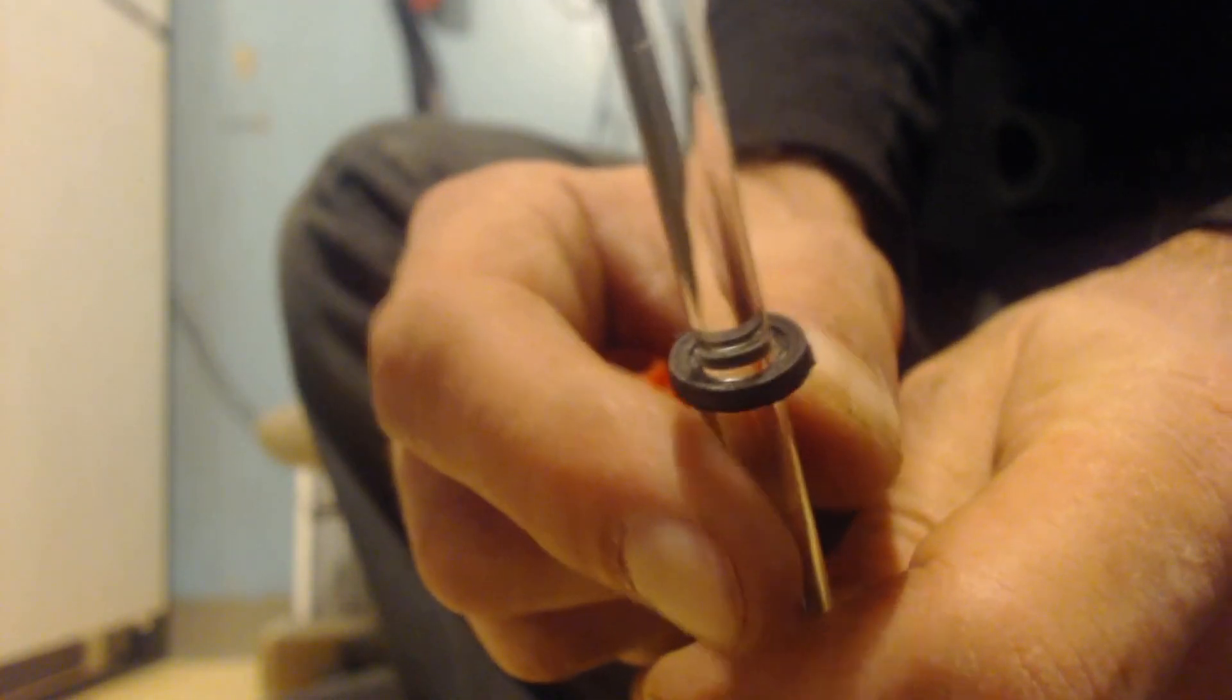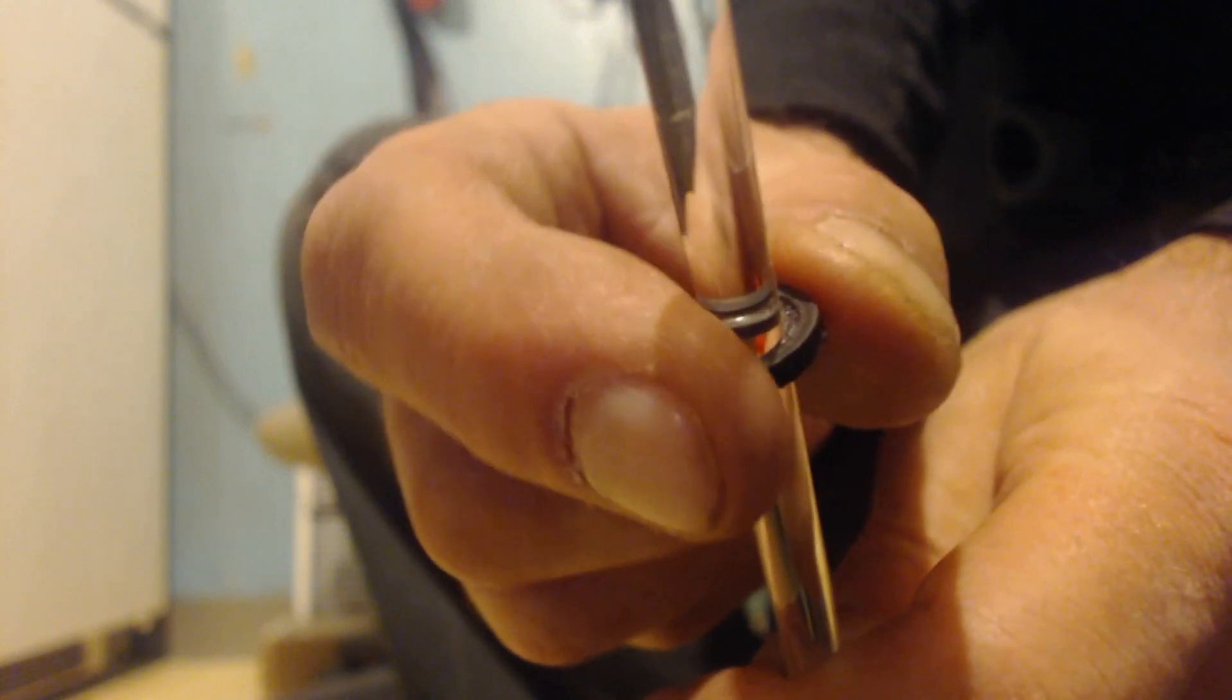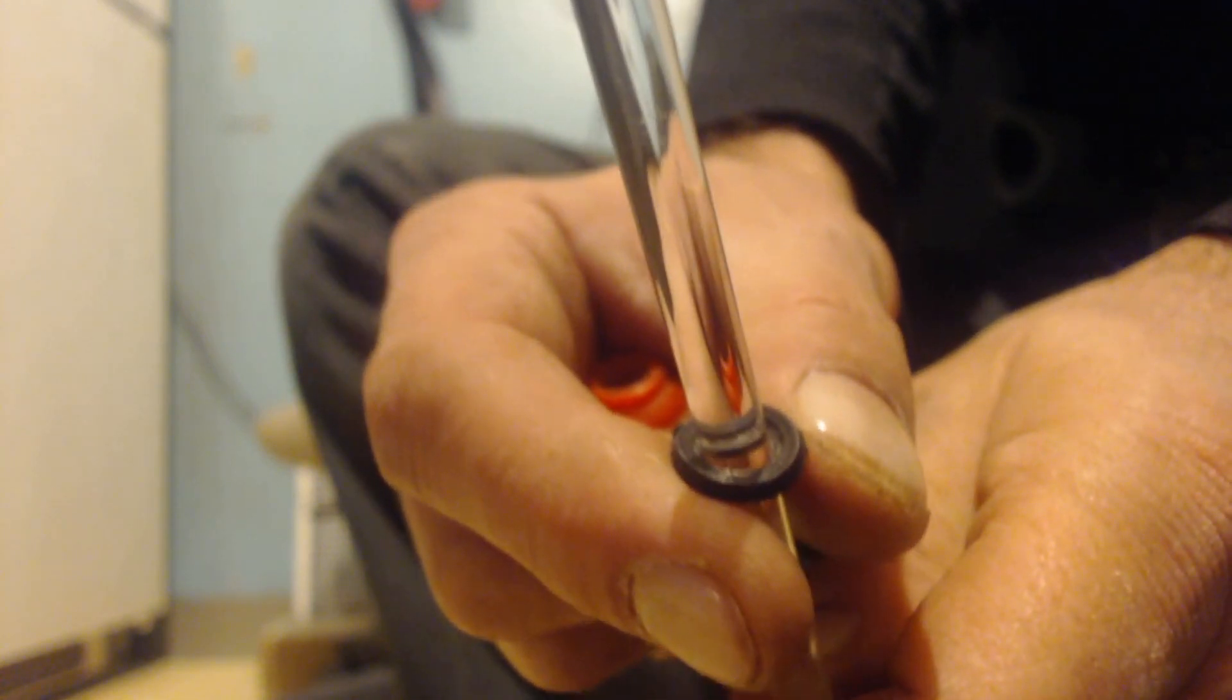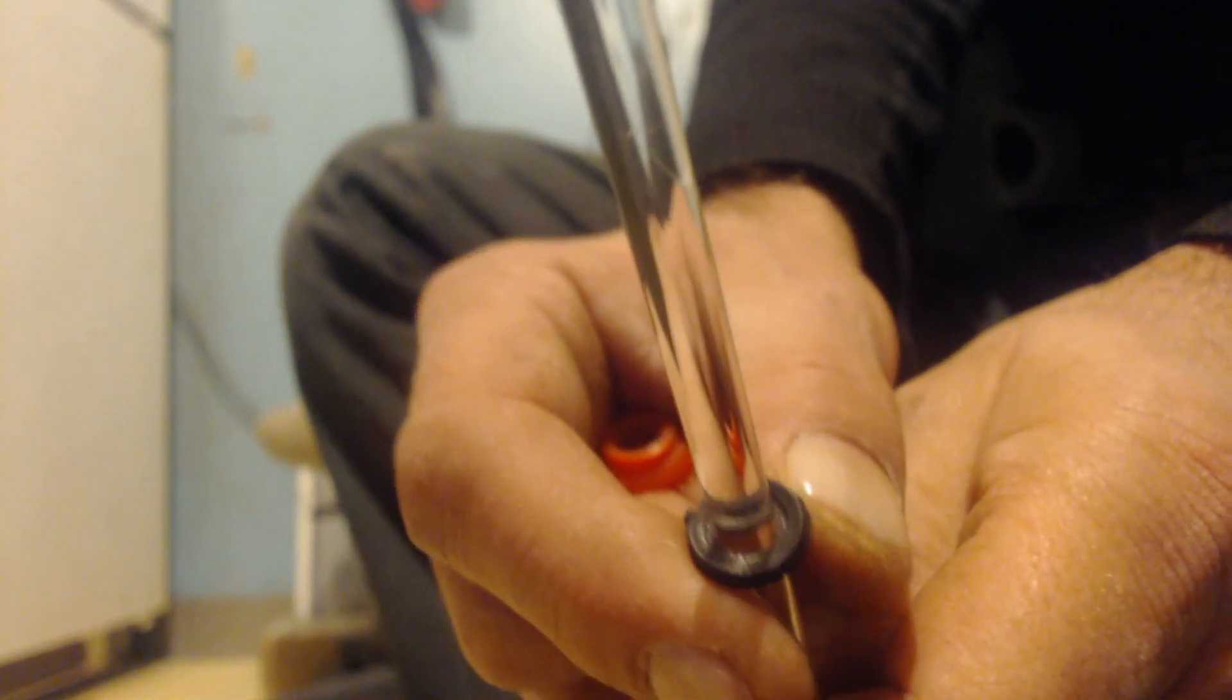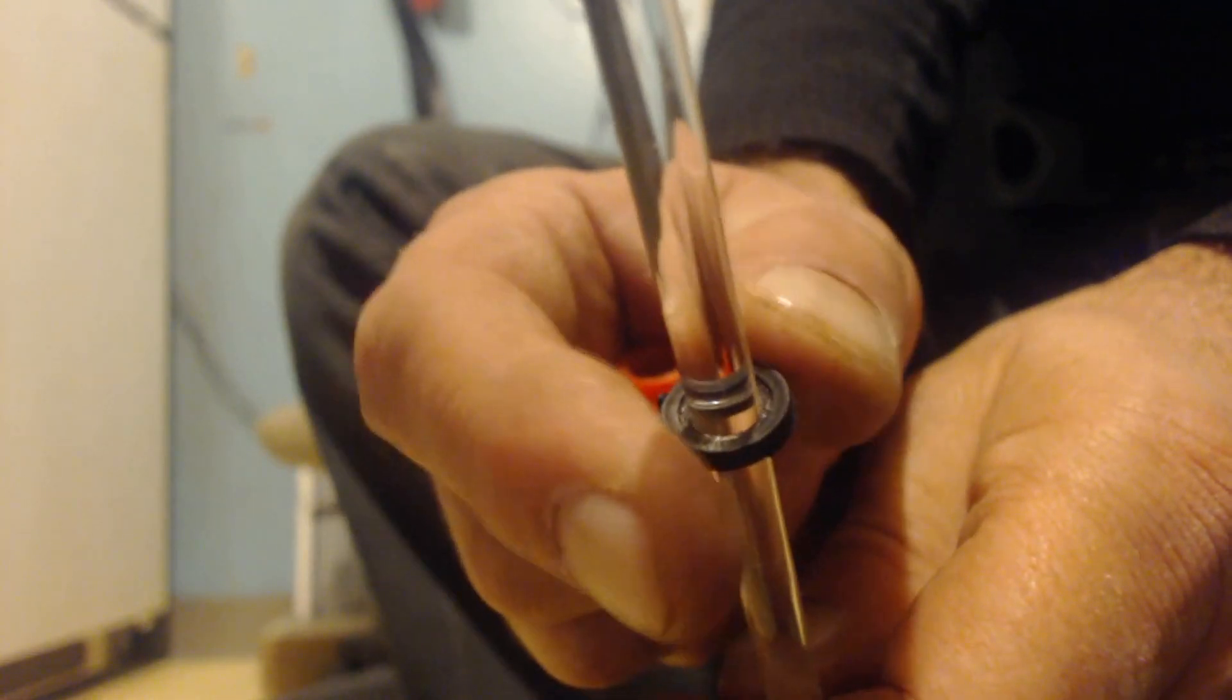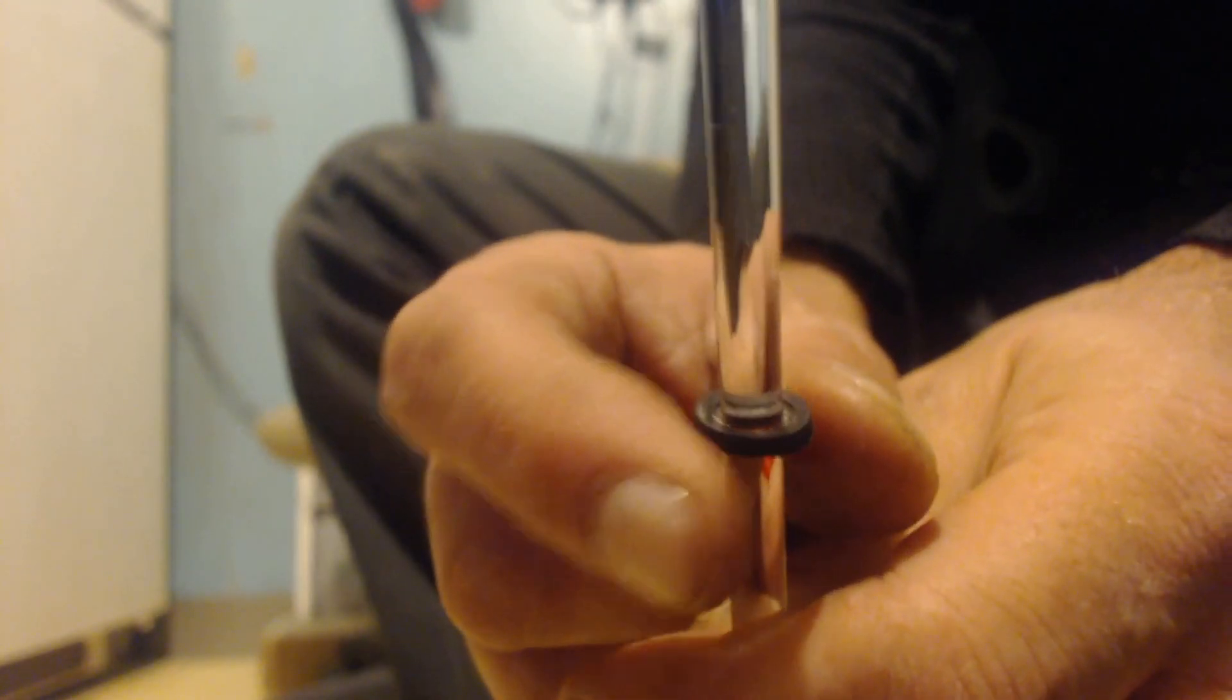And if I take the plastic part off, you'll see this black gasket here. You can see it's nice and snug. I actually take some pressure, not a lot, it'll take some pressure to move it up and down. So this easily turns.